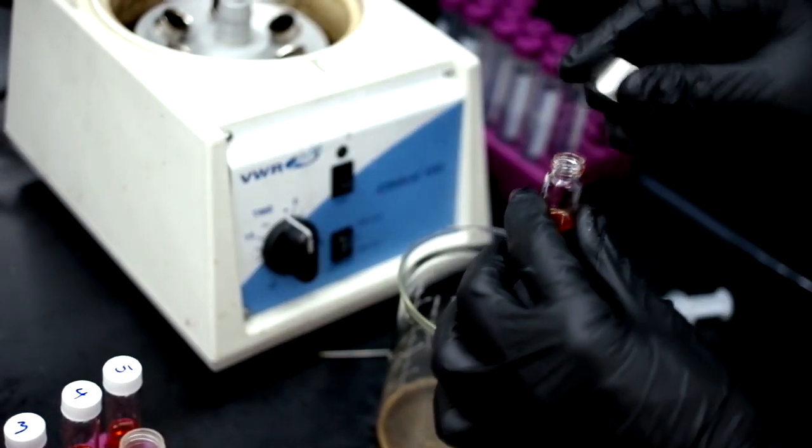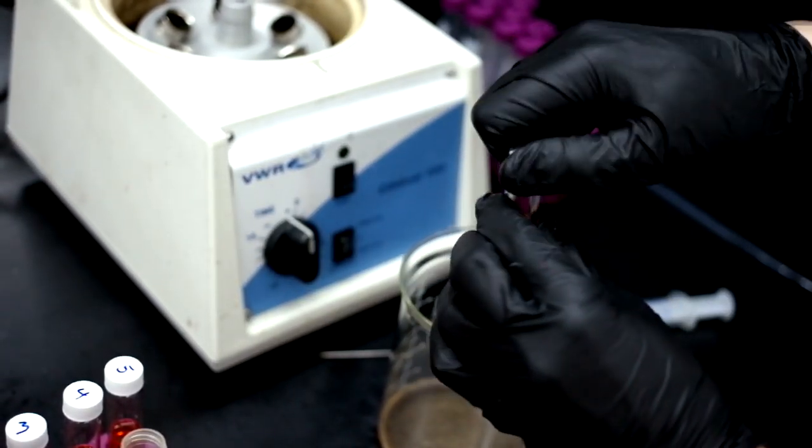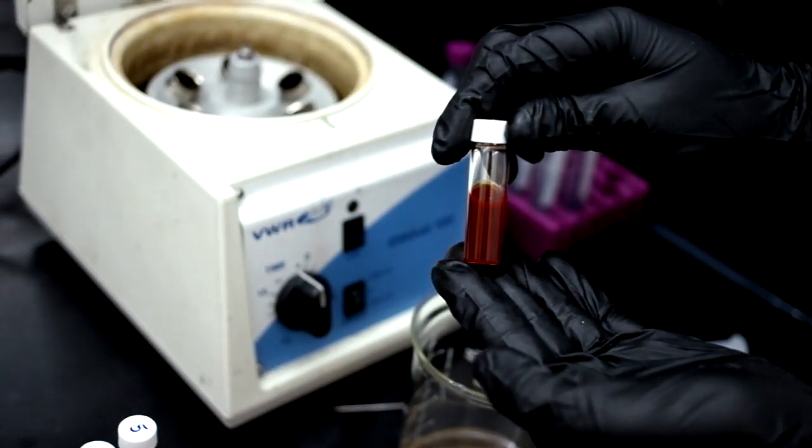Be sure to label your vial properly. This is your cadmium selenide solution.